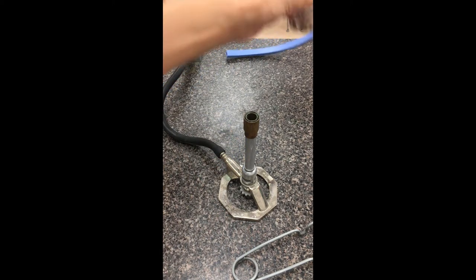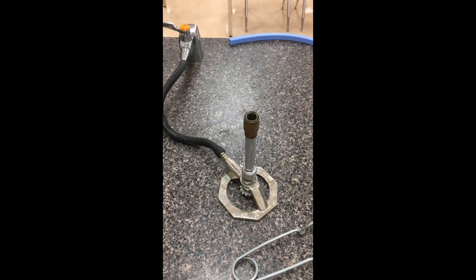I'm going to demonstrate how we're going to get this Bunsen burner going. We'll start with the gas valve — I'm going to flip it on. If you listen closely, you might actually be able to hear the gas coming through already. The reason why there's no fire yet is that all reactions — combustion is no different — require some energy input, some activation barrier, some trigger to get the reaction going.